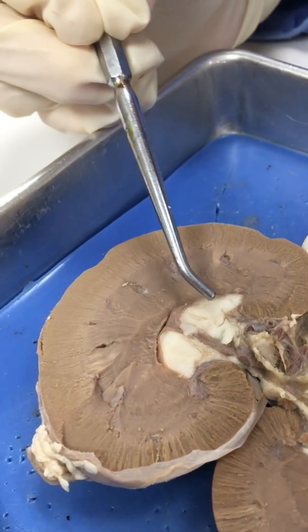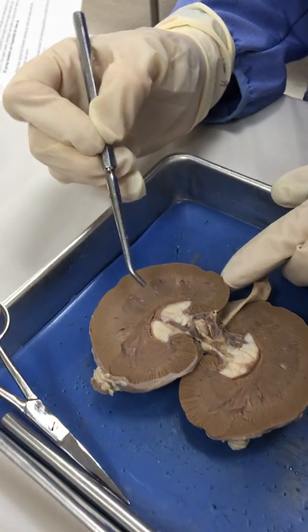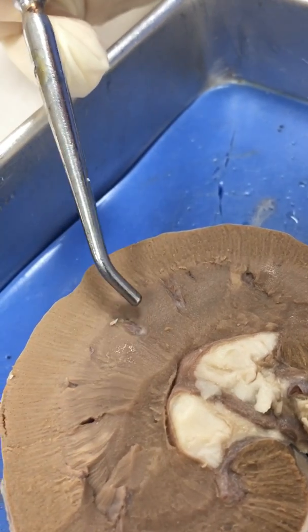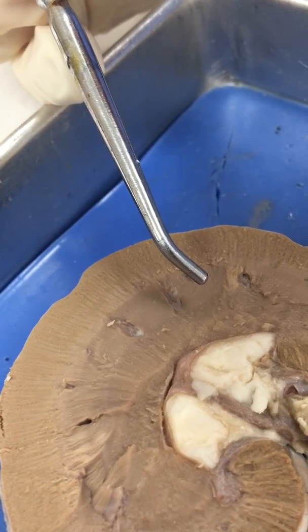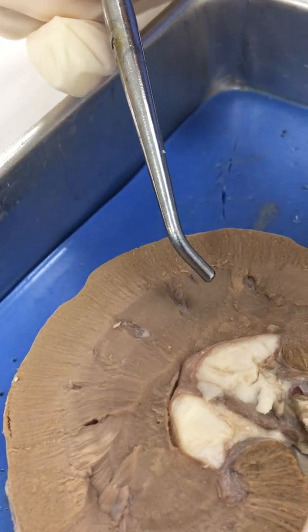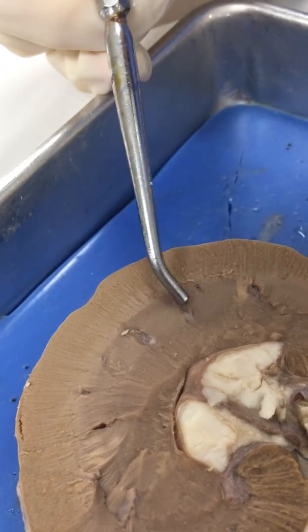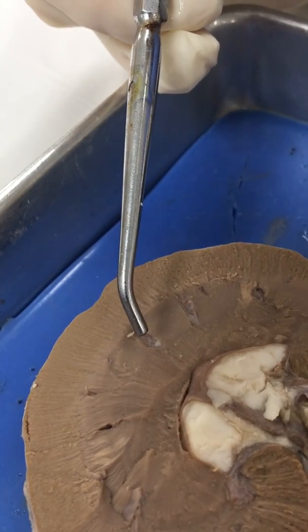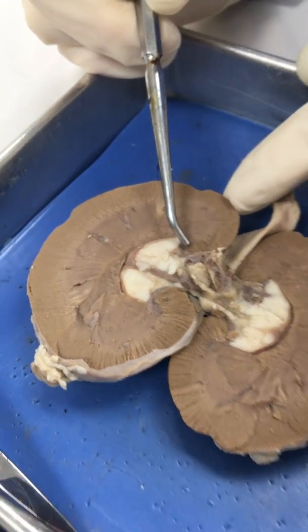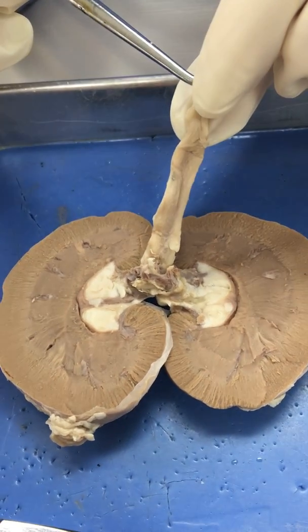The next part is the renal medulla. The renal medulla is where we start to get collecting ducts forming. This is a little bit hard to see, but we have little renal pyramids starting to show up, and we also see the calyces through here. These are the collecting ducts for urine that, after it has been filtered out in the renal cortex, starts to collect the waste and developing urine in this section of the kidney. As urine forms, we see larger collecting ducts forming in the renal pelvis, and then after it collects there it sends it into the ureter, which transports the urine down into the urinary bladder.